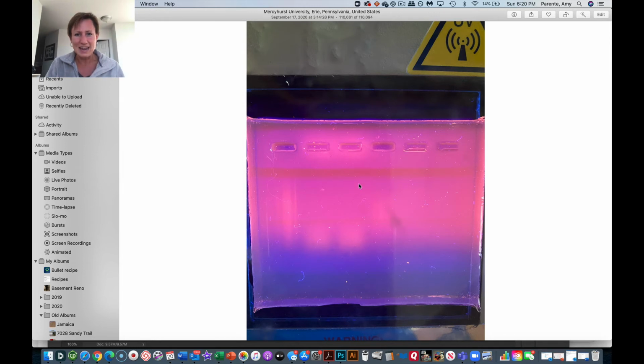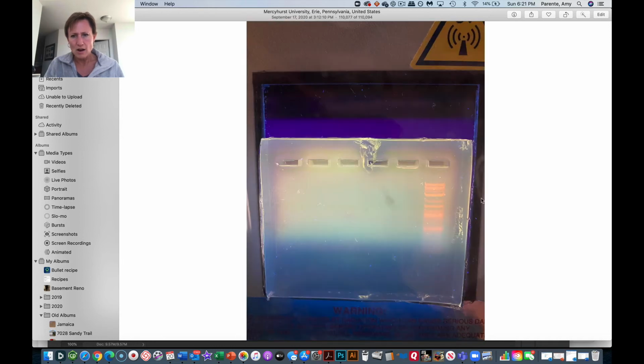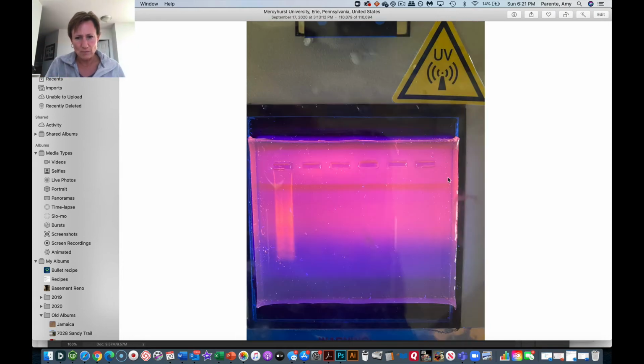I wouldn't want to take and say, oh, I like these two lanes best from this gel. I like these two lanes best from this gel. Oh, and this marker looks the best. So I'm going to just push those two together because you all really did the same experiment, right? So let's just put these three. You cannot do that. What you have on one gel has to be what you show.